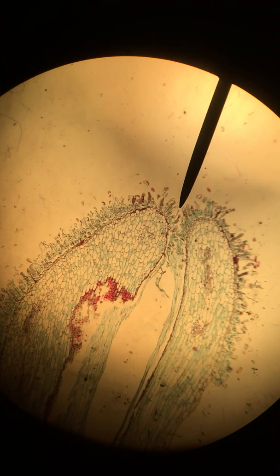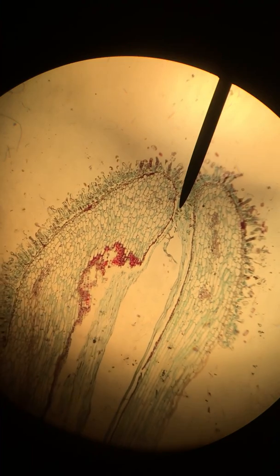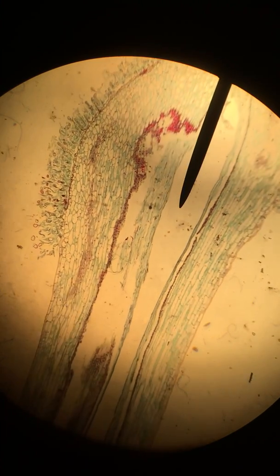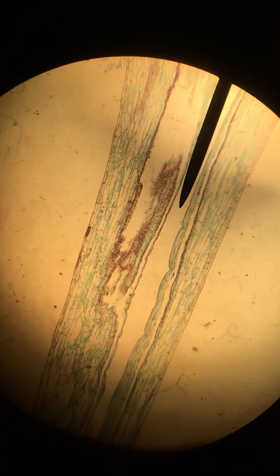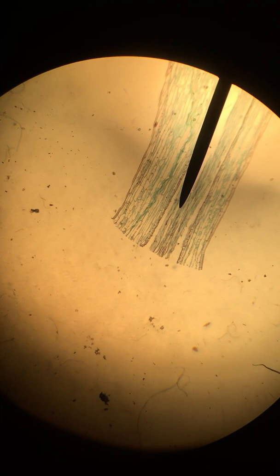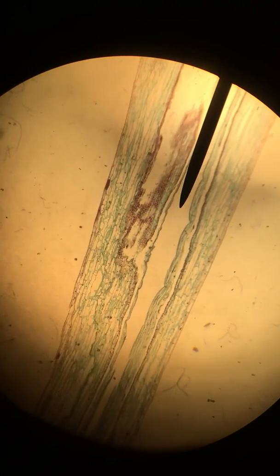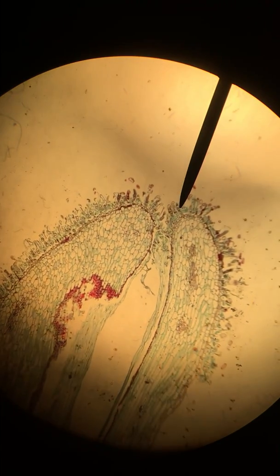Now, this is where our pollen tube from our tube cell will grow down, extend down, and as I had mentioned in the last slide, allow for the sperm to enter into a space called the micropyle, which will allow the sperm to access our mature female gametophyte. And so the pollen tube will grow down here in the center of our stigma and style.